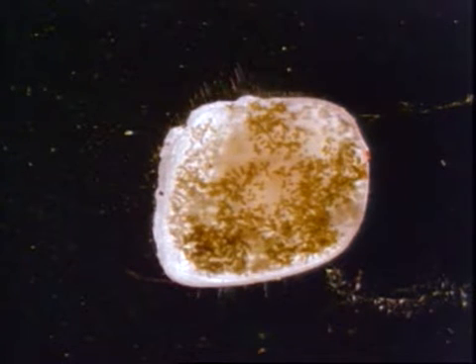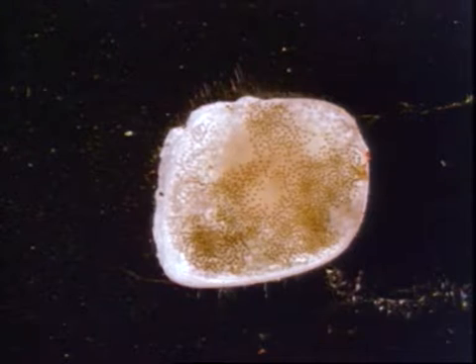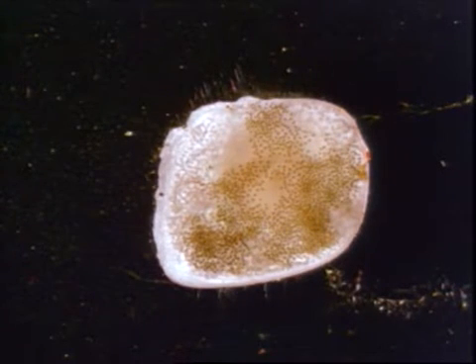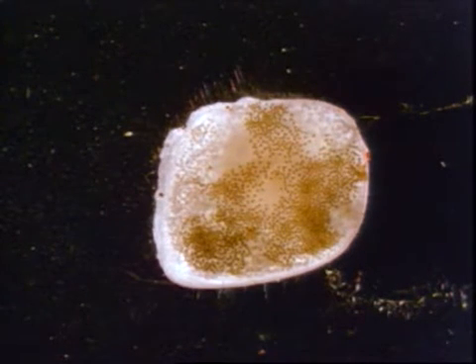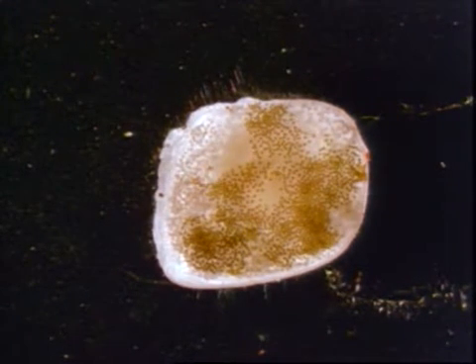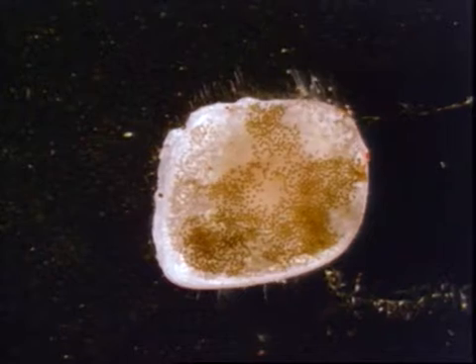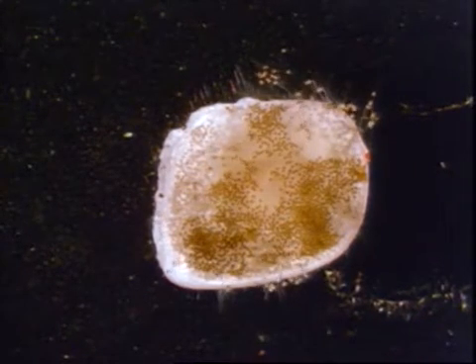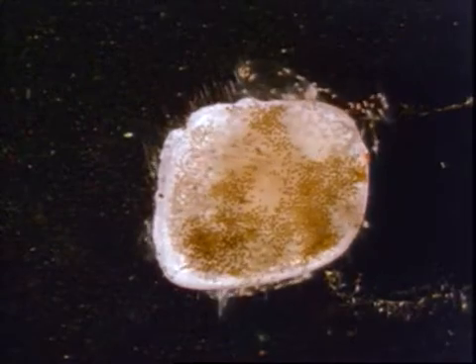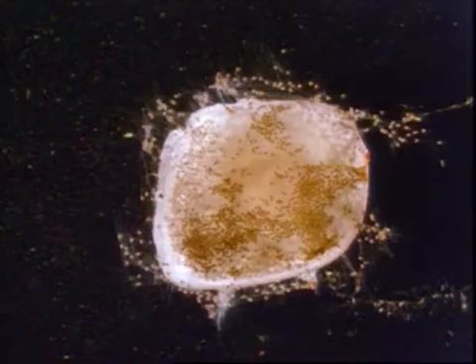After this, the daughter cells transform to the two-chamber stages. Upon the formation of this stage, a 13-hour resting period follows, rendered here in high time-lapse sequence. This period is terminated as the two-chambered juveniles are transported off the mother test. This is performed by protoplasmic threads of maternal residual protoplasm in which the daughter cells were embedded until this moment.